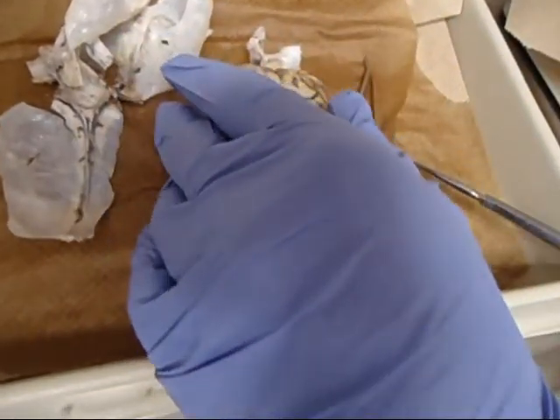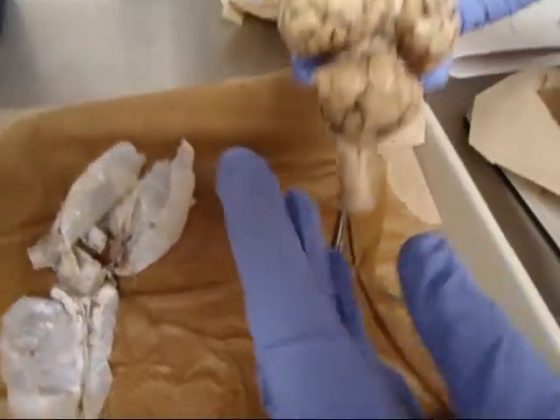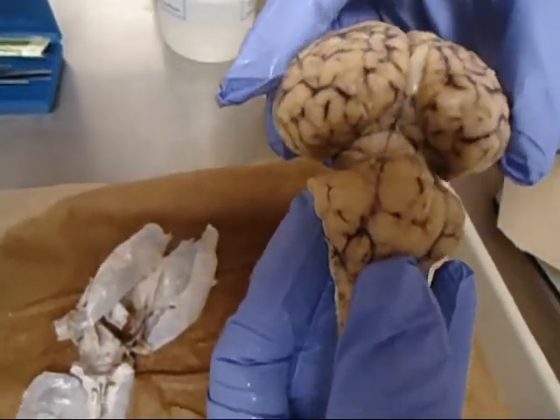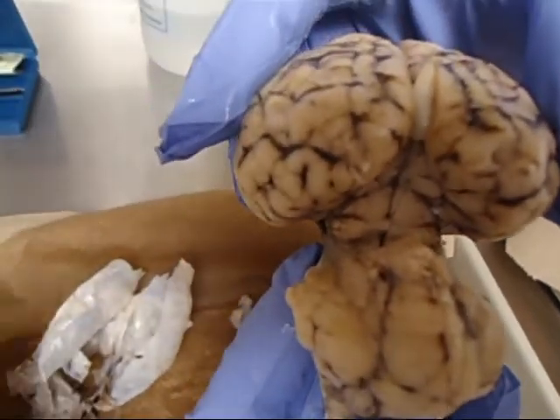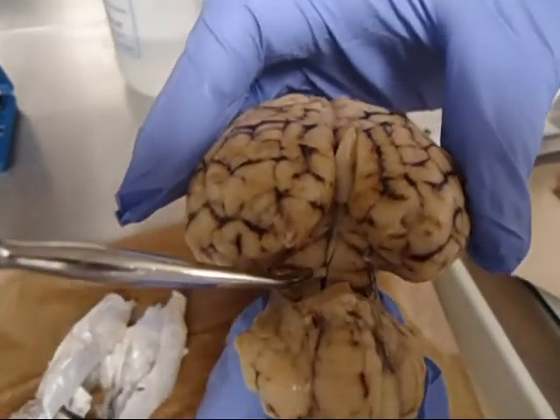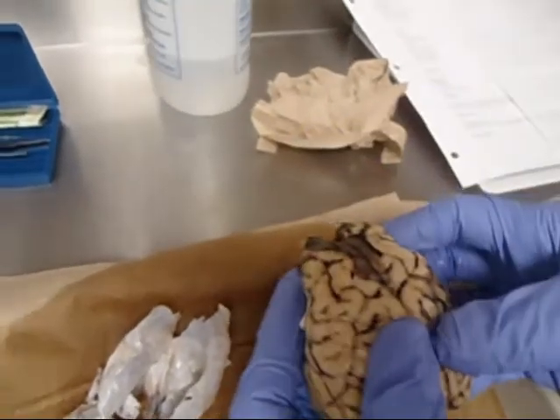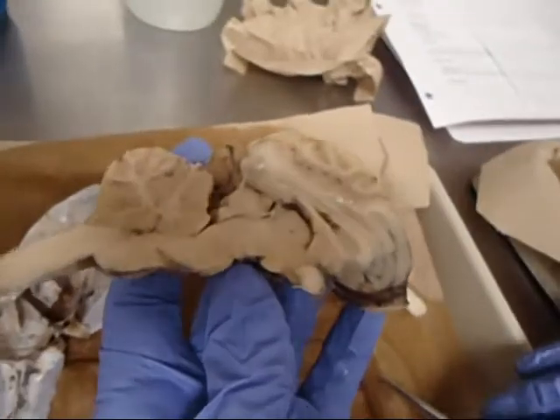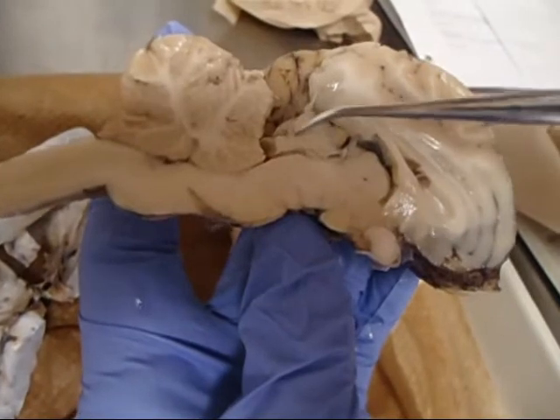The other parts are going to be the inside. He may ask you to locate the tectum in two different ways. The tectum is either in between the four lumps and bumps in between the cerebellum and the cerebrum. I'm going to point it down in this. There you go. And there's going to be four lumps, two round and two flat. Or he could ask you to locate it from the midsection. In the midsection, just look for the cerebellum and cerebrum, and it's going to be the lumps in between the two.